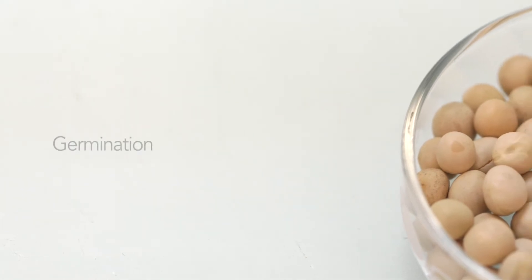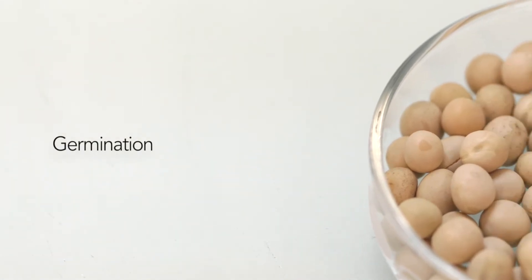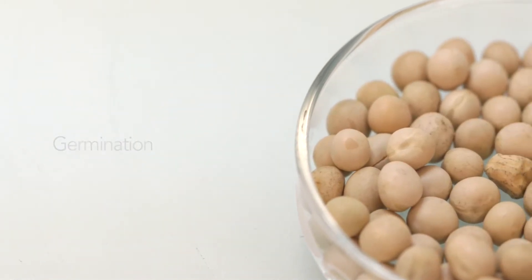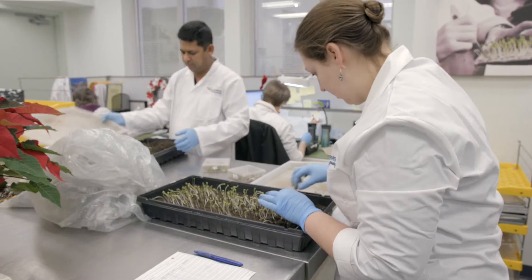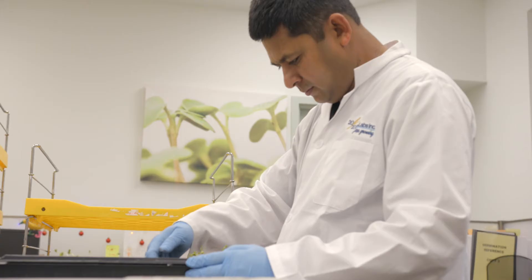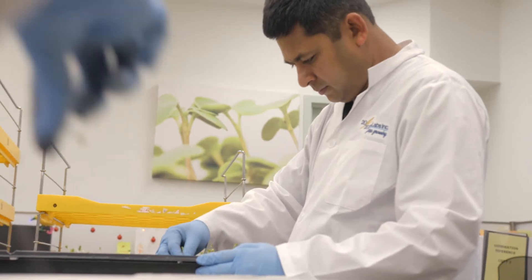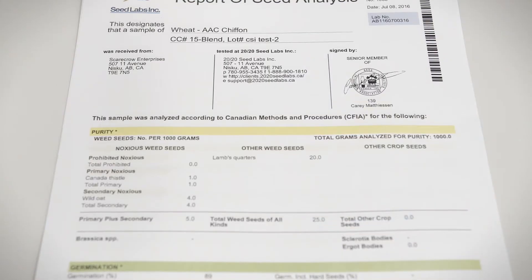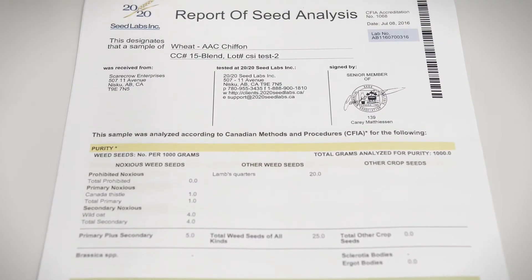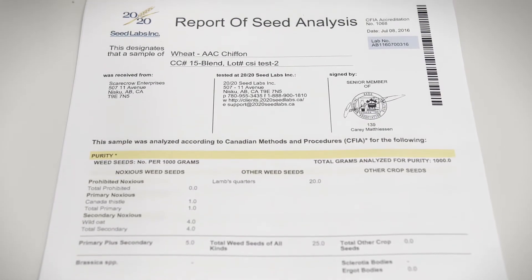Thank you for opening our link to reveal the results of your germination test. This short clip will explain what we found on our client seed samples and how we report the data on the report of seed analysis.